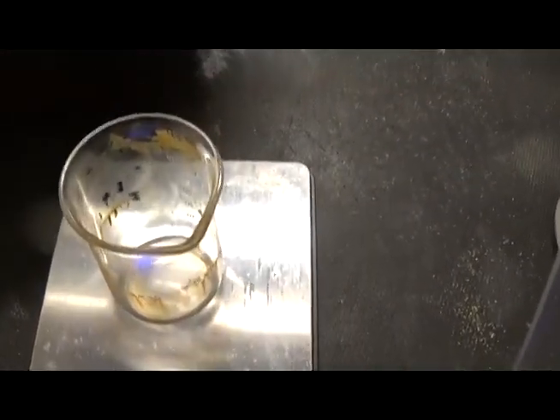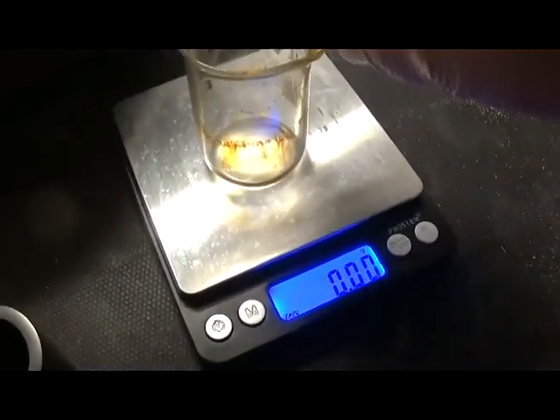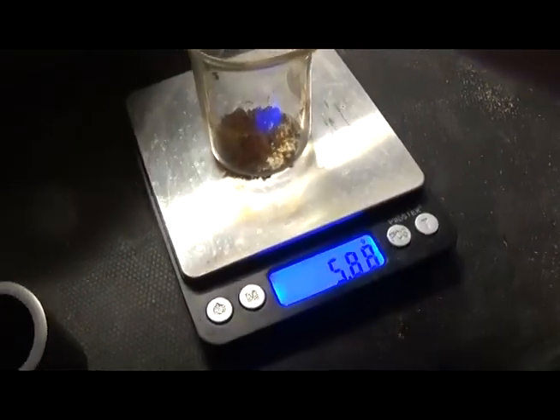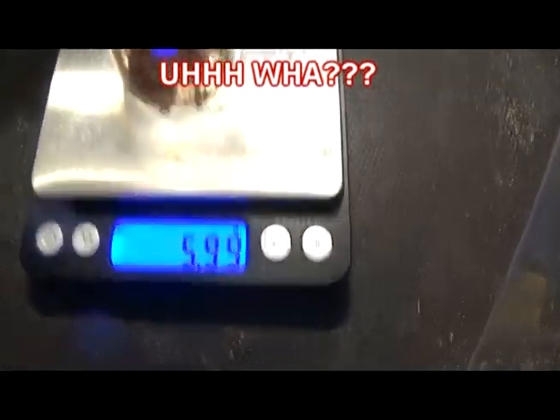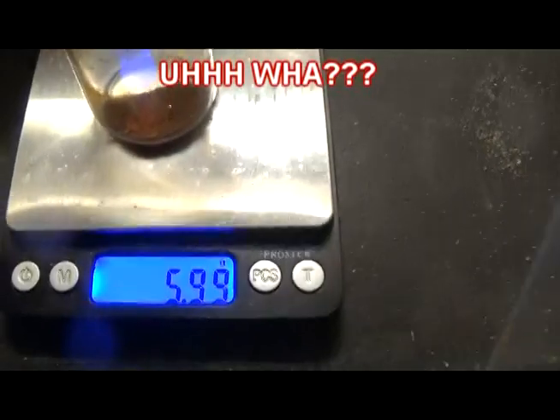Outstanding. Okay, we're gonna weigh this out, so I'm gonna transfer that to here, which is probably stupid, but we're gonna do it anyways. Let's tare this out. Now, very, very carefully, let's transfer the powder over. And it says we have, that don't make no sense, 5.99 grams gold powder. That don't make no sense.